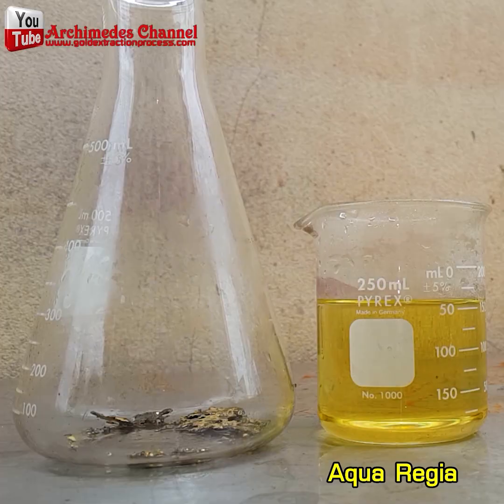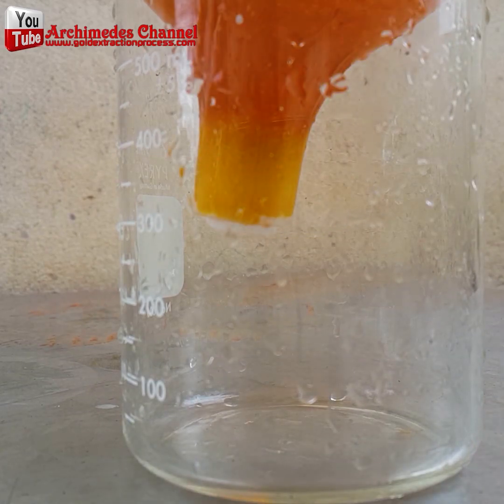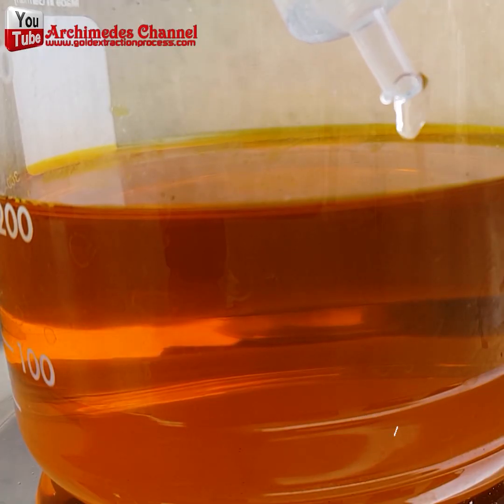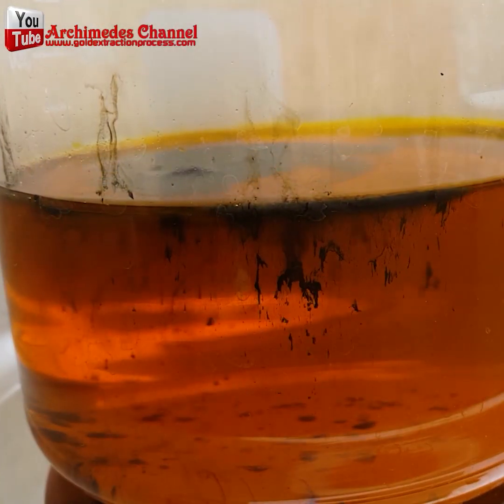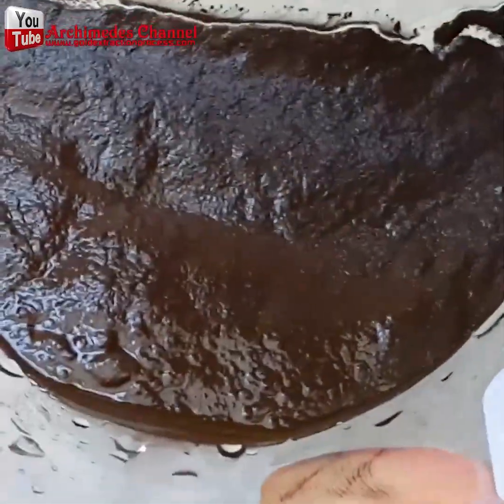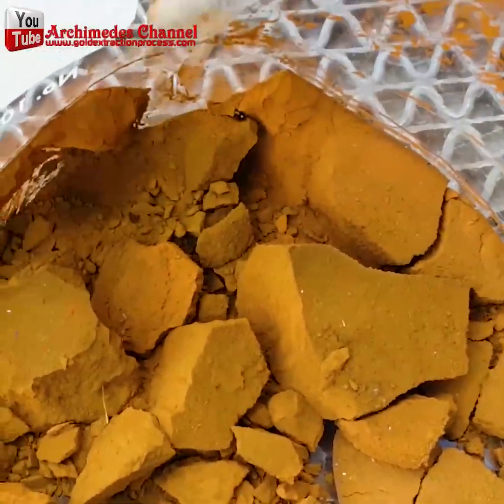Now time for that chemical reaction — melting away the unwanted with hydrochloric and nitric acid mixed together, poured over top of the scrap gold. Just give it some time. Watch what happens, and then once all that's done you can filter it. A little black dust emerges in there, a little at a time, and the sediment drops to the bottom. That chemical reaction is separating that black sludge that contains — you guessed it — gold.